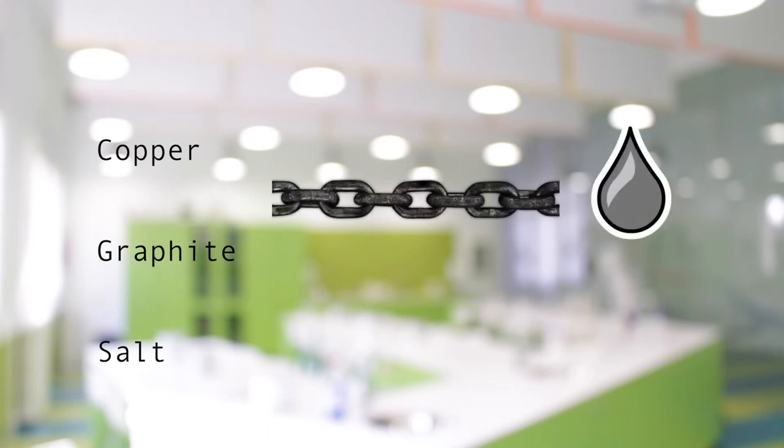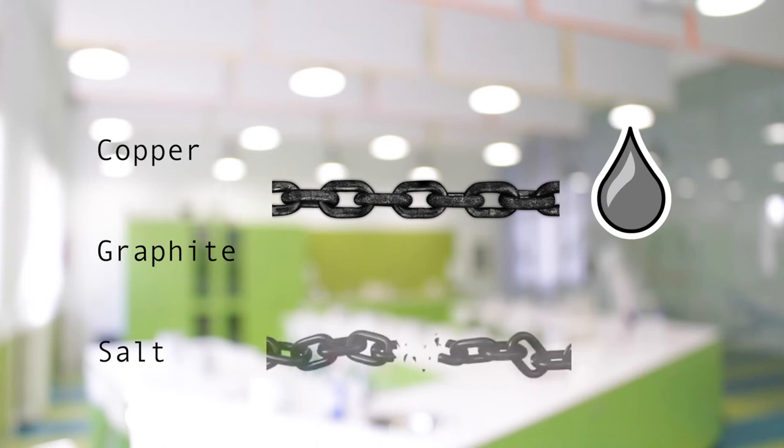As for solubility, copper and graphite have got very strong bonding forces, and that's why they don't blend in with water. Salt, instead, hasn't got that strong bonding forces, so it blends in with water.